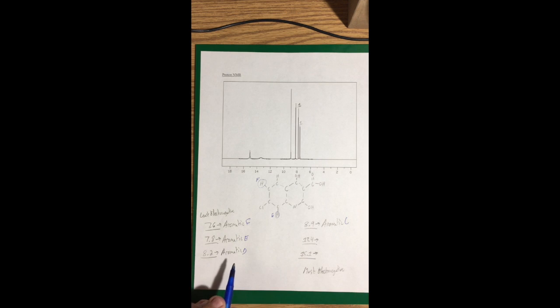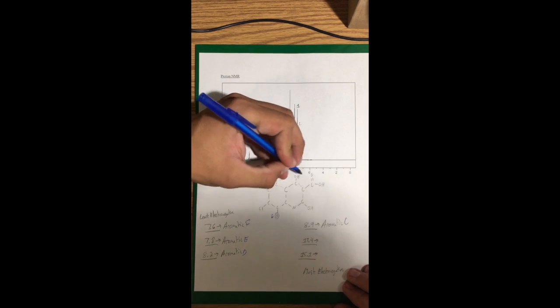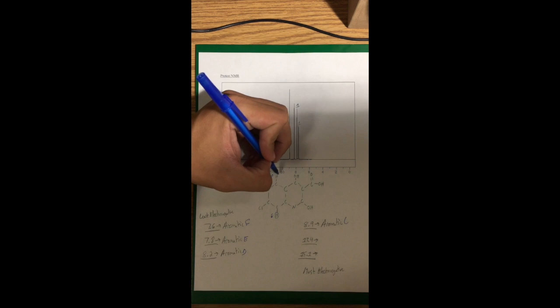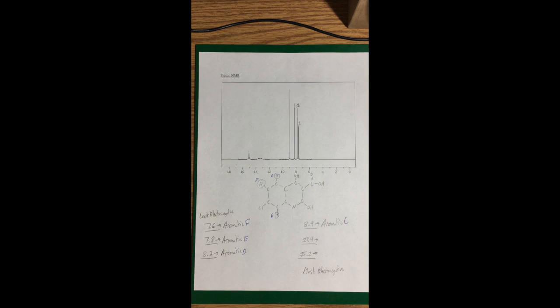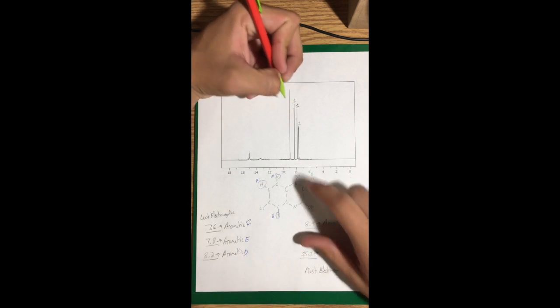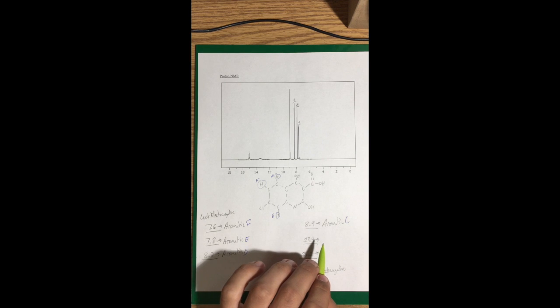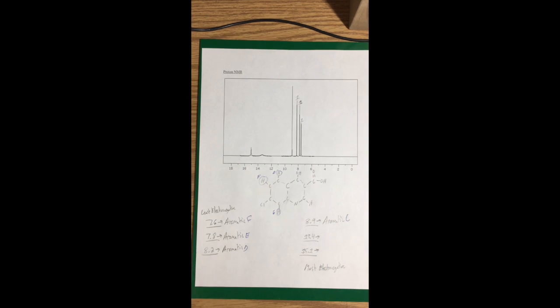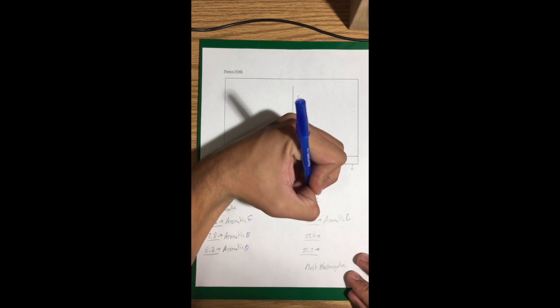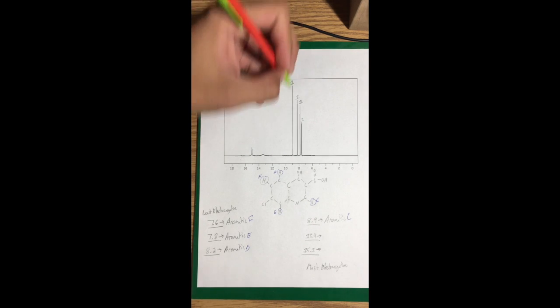Then the next one, D, is up by F over here because we're working our way closer to the electronegative part of the molecule. Labeled that at 8.2, it counts for 1 hydrogen. And then the last one of the aromatic, 8.9. As we look at the C part here, the last one of the aromatic, which you can see is right here, I'll label that C and circle it for you. Also, it accounts for 1 up here, so I'll write that down.